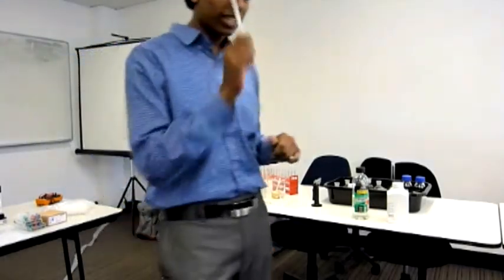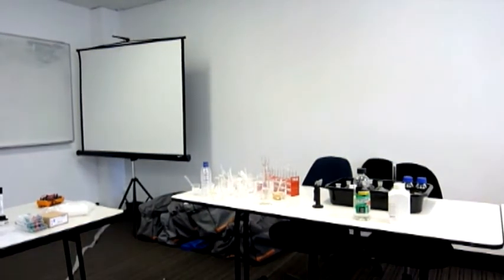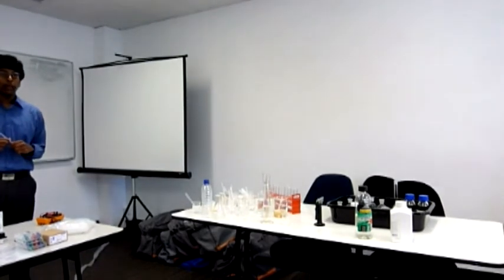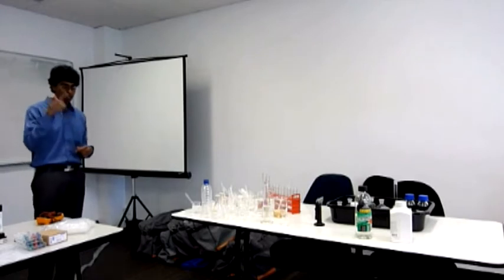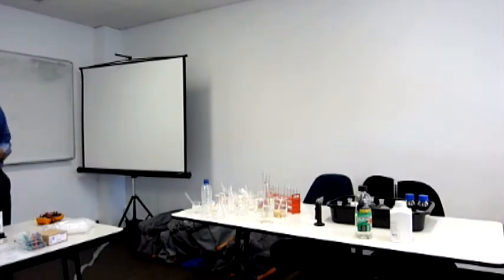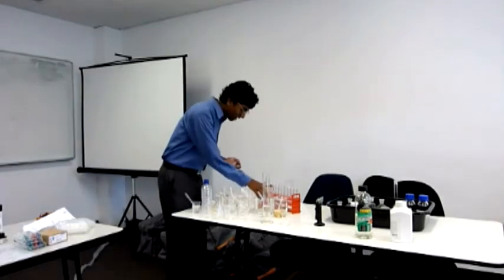Cool, so we need to learn this. Just remember it in steps and it should make perfect sense. Remember the table that we did? If you remember that table in the steps, in the order of it. Okay, so let's start. I hope it all works out. So we're testing first, we have our anion solution.